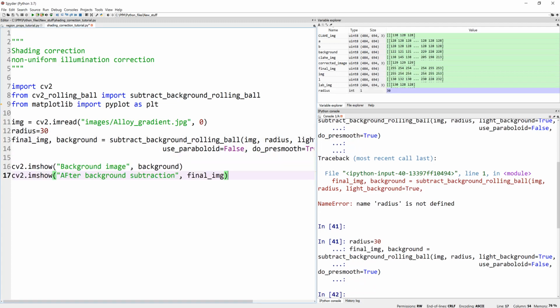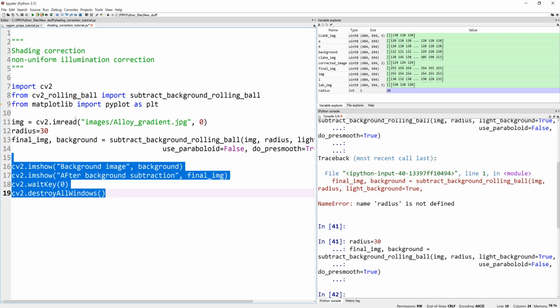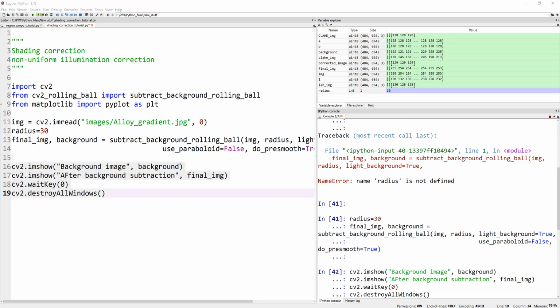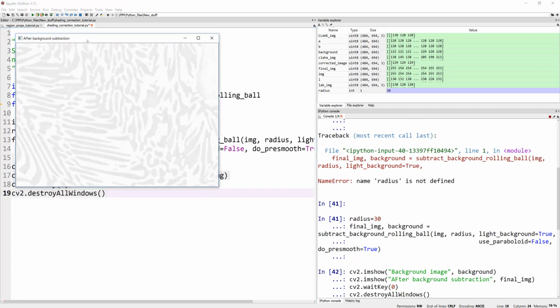So now let's plot it and have a look at it. The way we do this is, as you probably know, cv2.imshow, and do not forget the cv2.waitKey and destroyAllWindows, otherwise it gets stuck over there. So let's run these lines to visualize our outputs. It's on my other screen, so let me bring it here.